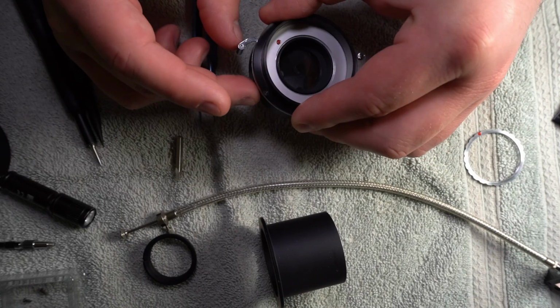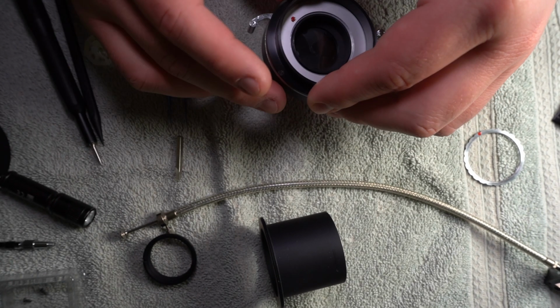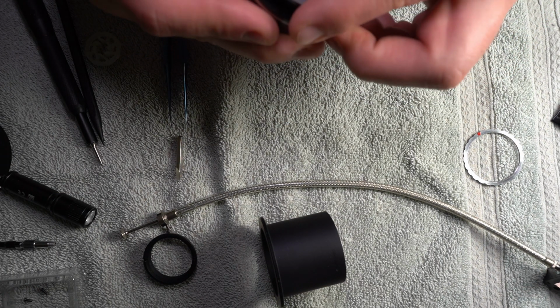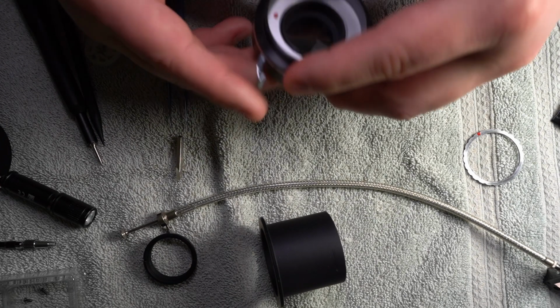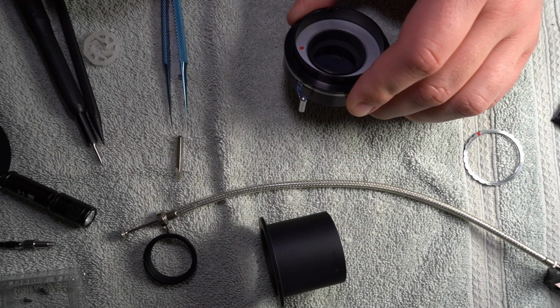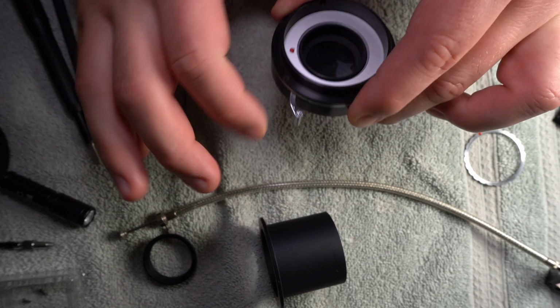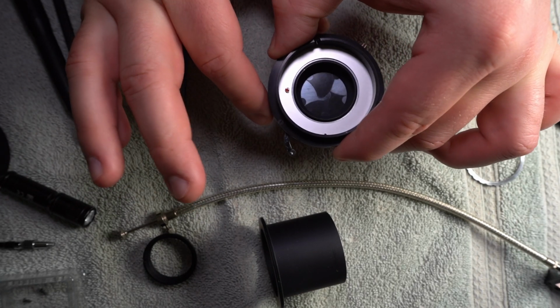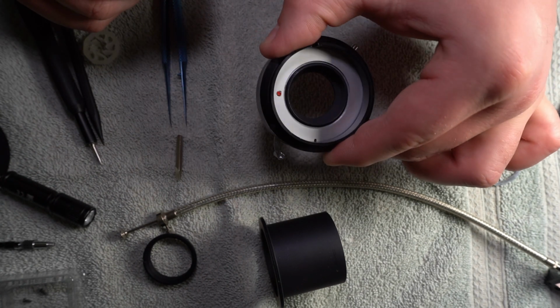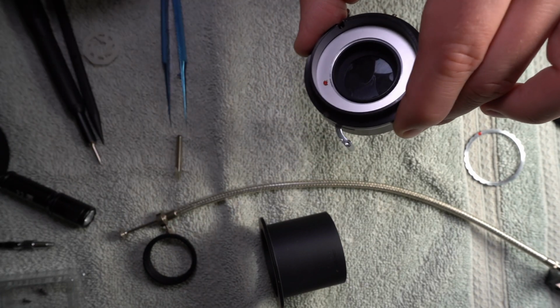So this is the fastest shutter. And I don't know if you can even capture that, really. And then if I go to the other end of the spectrum, we've got, I think, bulb and then time. Do we? Yeah, we do. And so at that point, you cock it, fire it, and it stays open. You can see that it stays open, and then fire it again, and it closes.